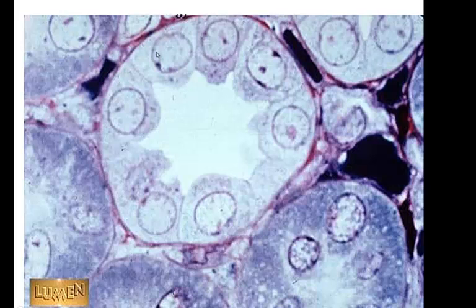What I was saying before, if you're wondering why isn't this considered stratified, because here's the basement membrane right here to our simple cuboidal epithelium, and here's the open lumen up here. So here's the apical surface, and here's the basal surface, and then underneath this basal surface, this basement membrane, we have connective tissue down here. If we had another layer of cells, then it would be stratified, but we don't have another layer of cells. We have connective tissue down here.